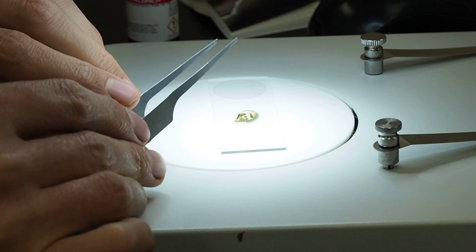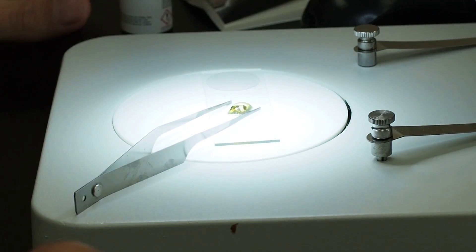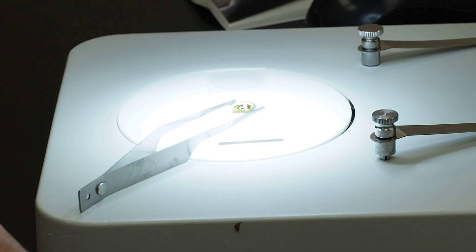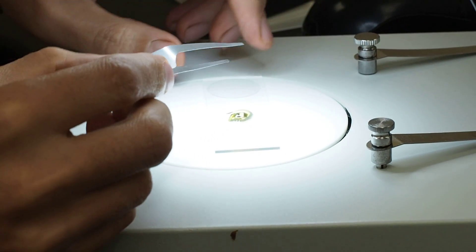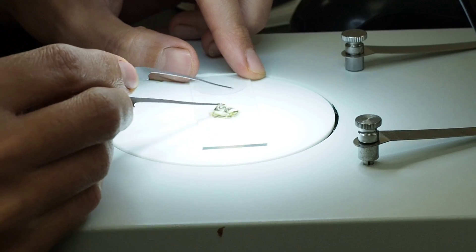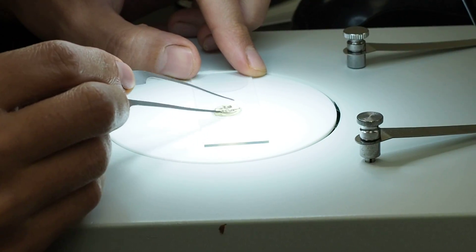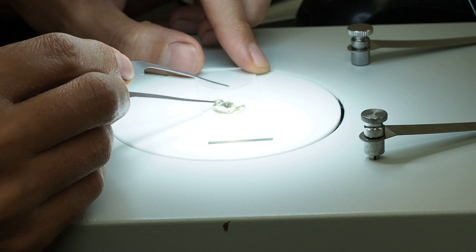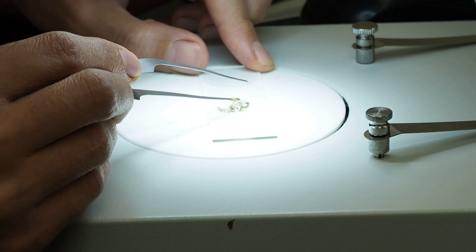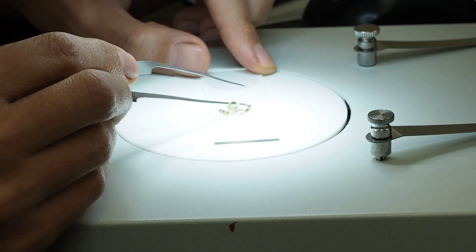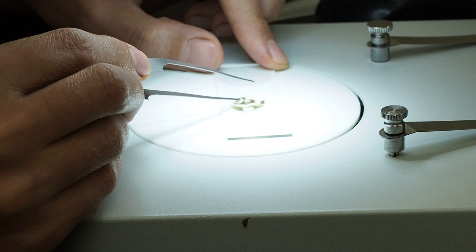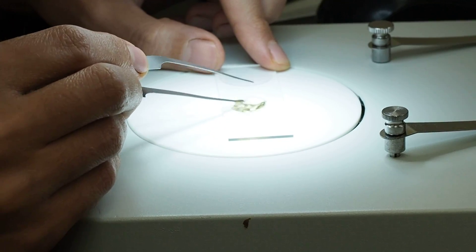Put a cap back on so we don't spill everything. And then you can mix it a bit, kind of spread it out to about the same size of the cover slip. Probably use too much clove oil here. Yep, it's a little too much clove oil, so maybe three drops, maybe two. I don't know the size of the drop. Yeah, thinned it down a little too much, it's a little too aggressive thinning it down.